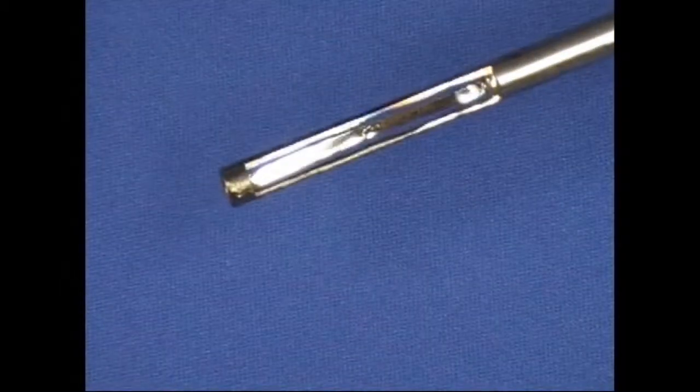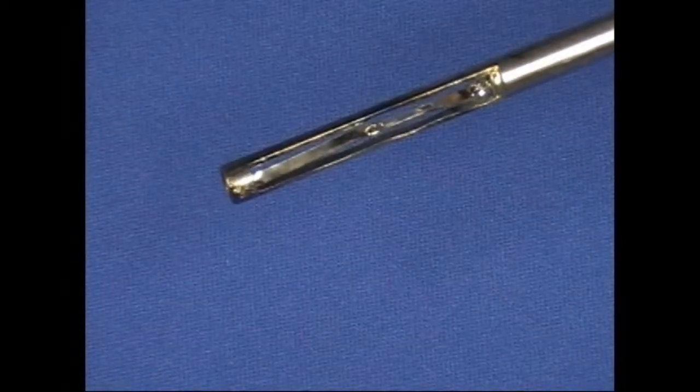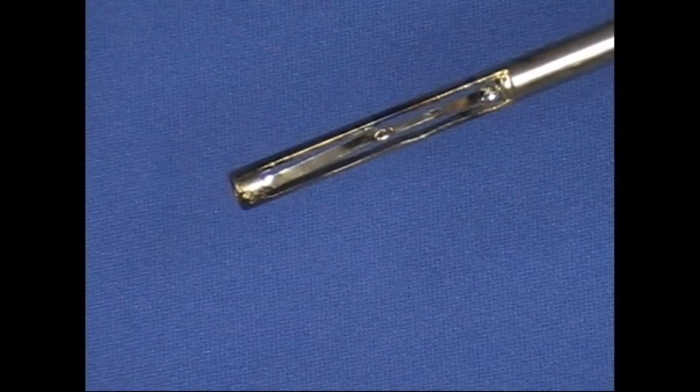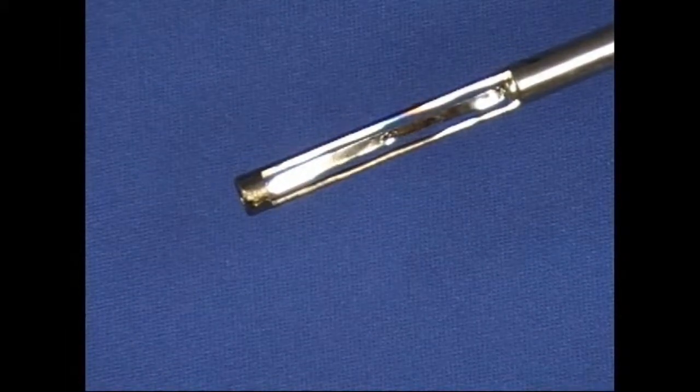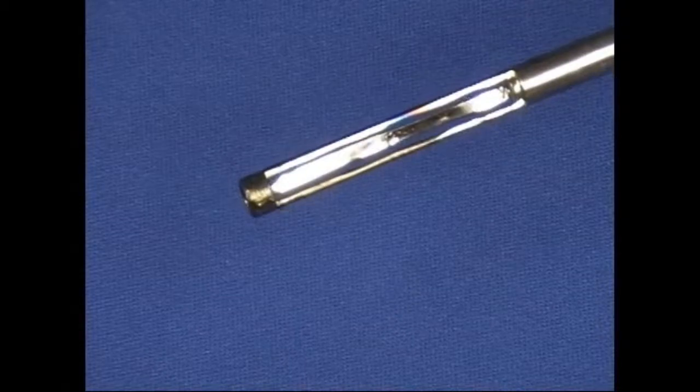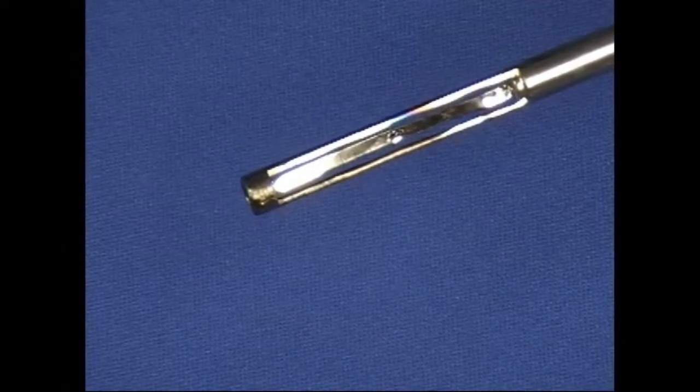So you then have your solvent right in the middle. Use the dry function to remove the residual solvent, and that leaves the solid material left as a residue right on the filament of the pyroprobe.